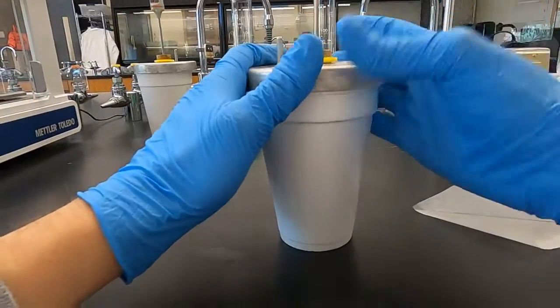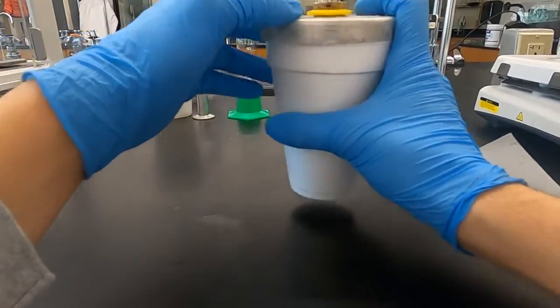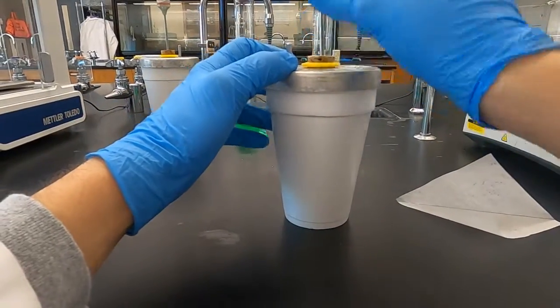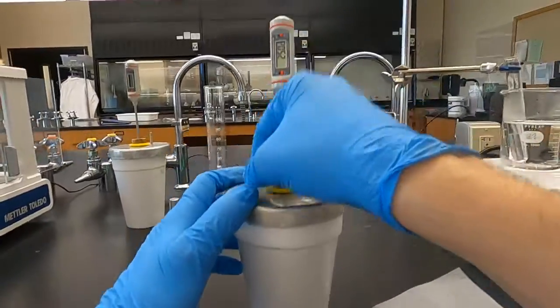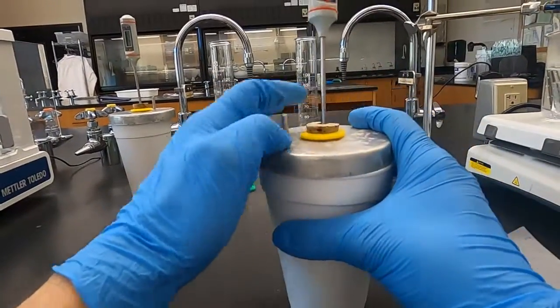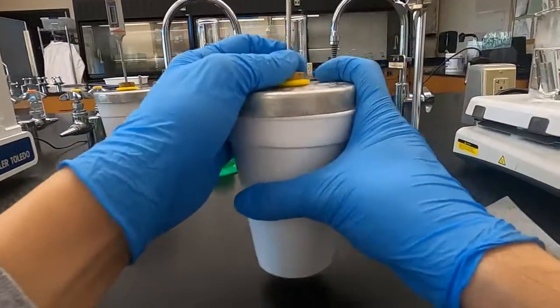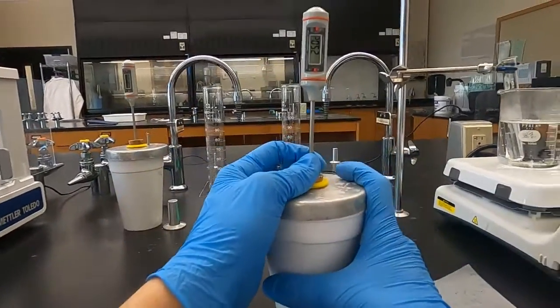Again, make sure all this dissolves. Try and keep this lid on so that it's sealed. We might be about done. I'm gonna wait for a decrease before I call it, but it's been at 25.0 degrees Celsius for a while.